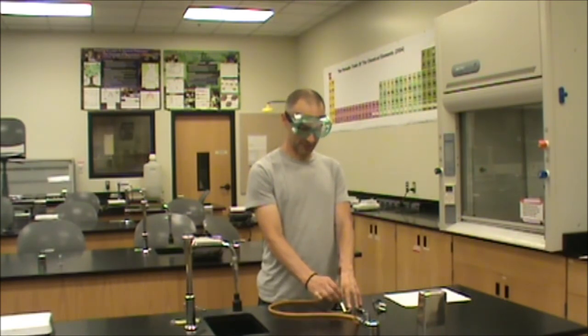You'll see the flame becomes smaller and blue. And you'll eventually see that small cone of bright blue flame in the middle, like we discussed earlier in the video.